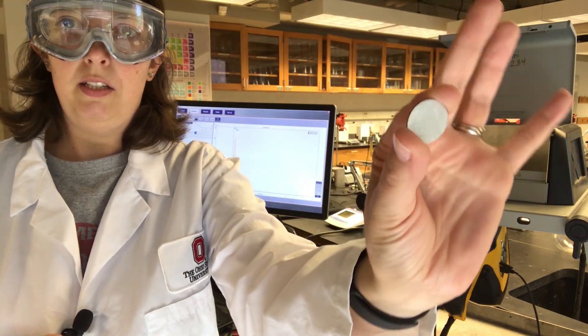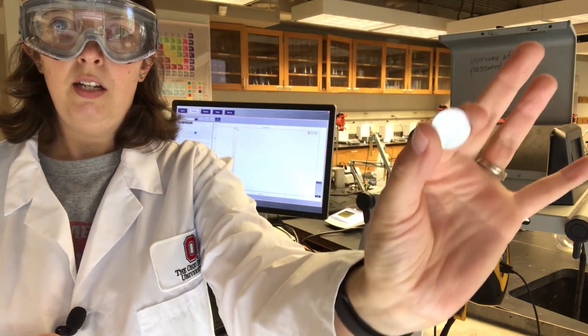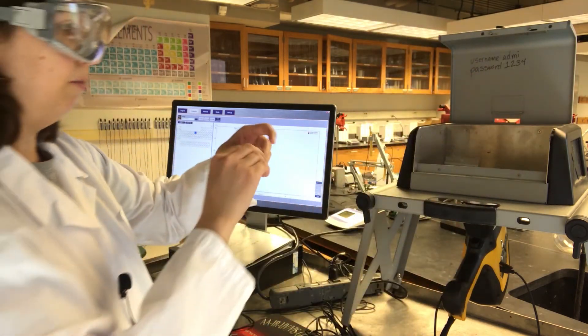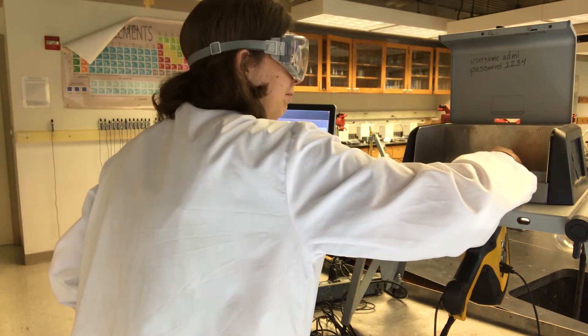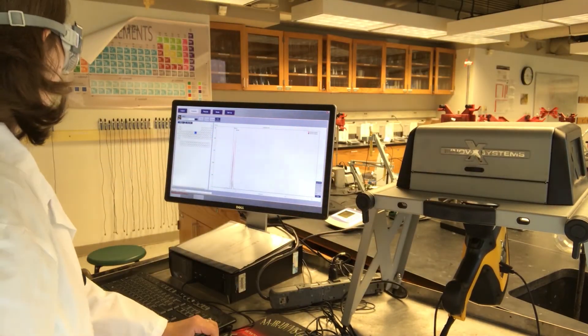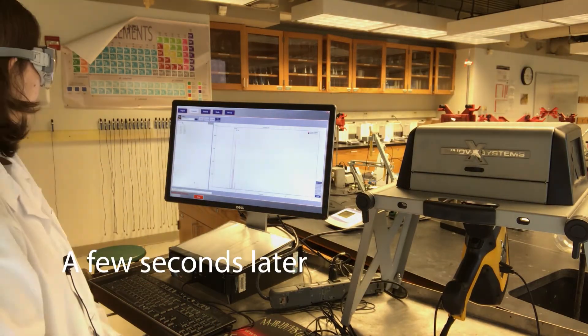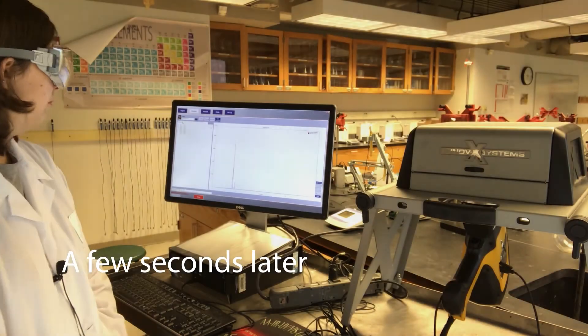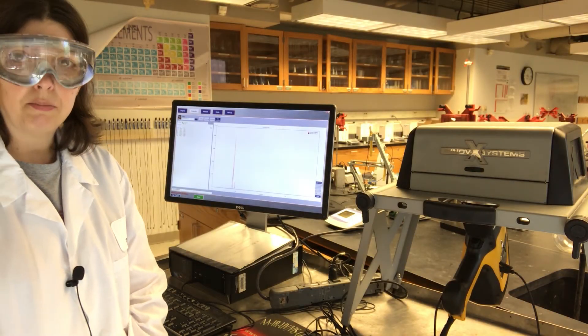Now I'm going to run the silvery side and put that side down. We'll see what this is made of. The test has completed.